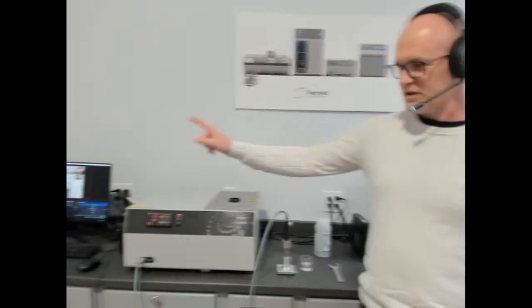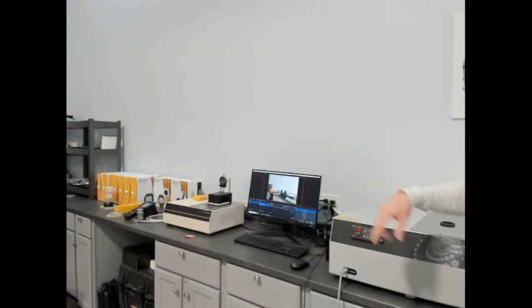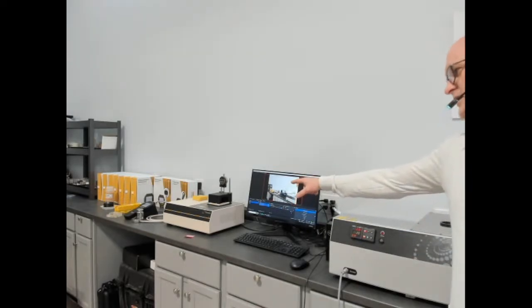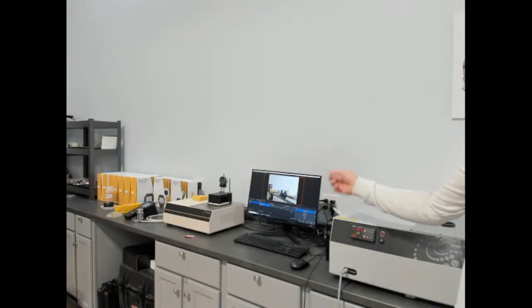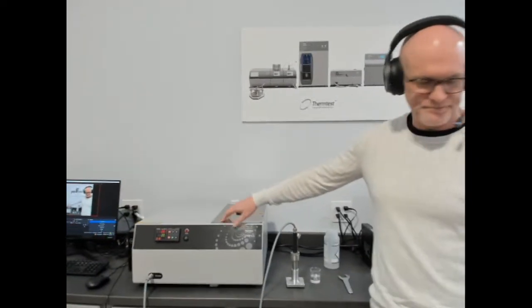So, turning the camera to the left, we have our MP2, which is basically what we would call the portable version of the measurement platform series that has a range of primary methods for measuring thermal conductivity: transient plane source for solids, transient hot wire for liquids, and transient line source for soil and polymer. Then we have our baby brother to the heat flow meter series, our HFM25 for measuring small format insulation, and then the THW-L1, which we'll talk about.